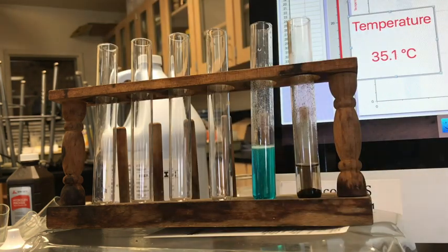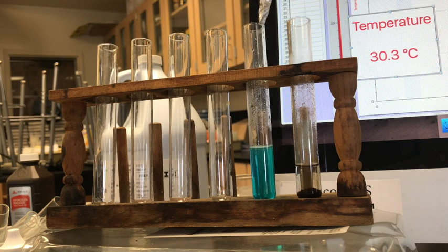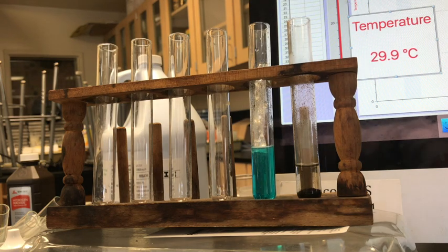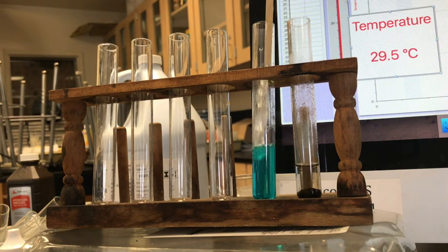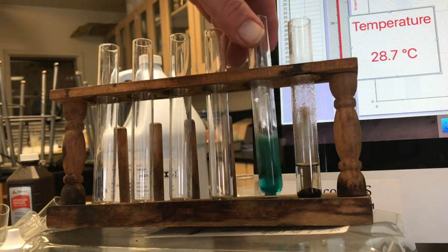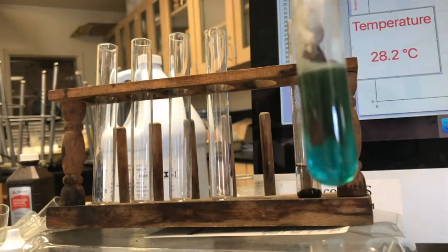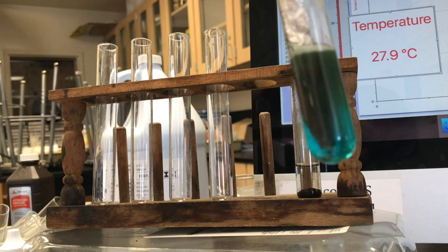All right, so now we're going to add some aluminum. So I'm going to take a piece of aluminum foil that I can put inside. And we're going to react an element. This is just aluminum with a compound, copper and chloride. Let's push that down. And you can see the reaction. Let's bring it a little closer. Then focus, there's a darkening.